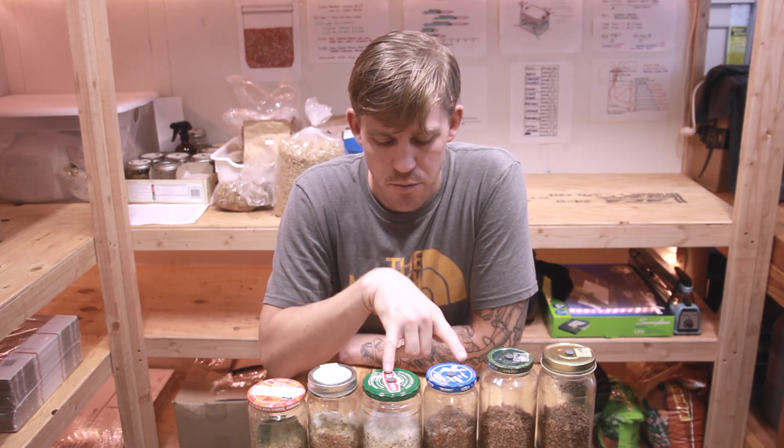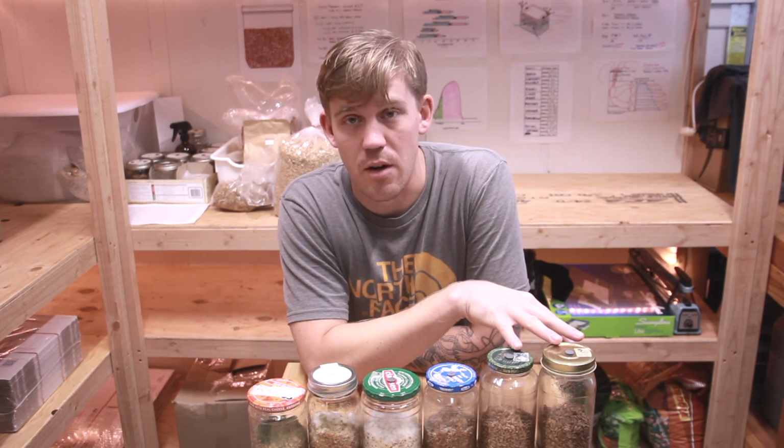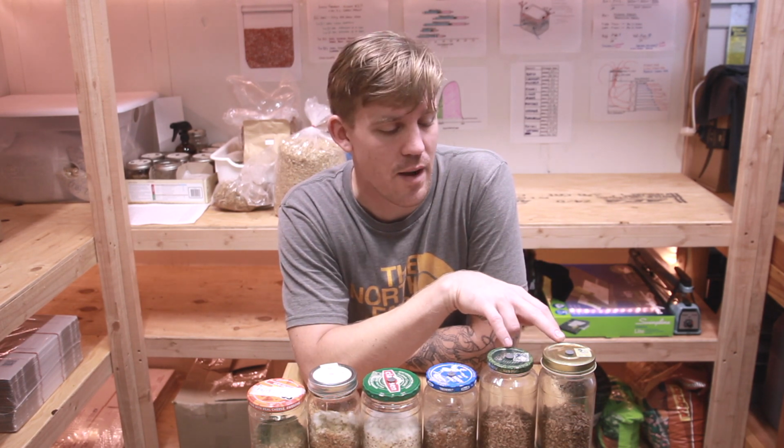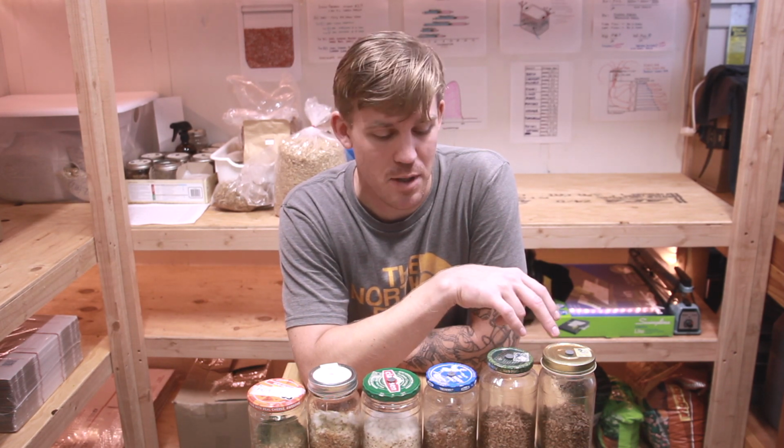And then jars 3 and 4, I prepared the grain like I normally would, except I didn't pressure cook. Instead of pressure cooking, I put the grain into a pot on the stove and boiled it for 30 minutes. And then these 2 didn't colonize at all, which is kind of weird, but I prepared these just like normal. These were supposed to be my control samples. I don't know why that happened, but sometimes that just happens.